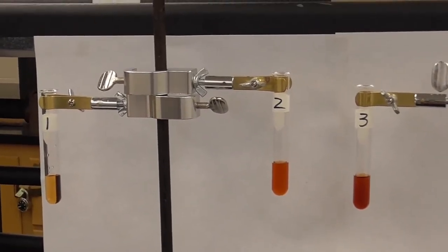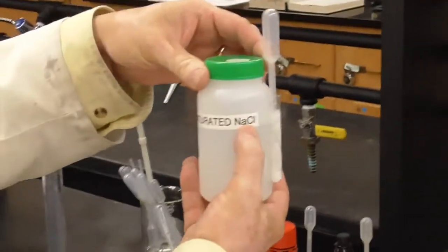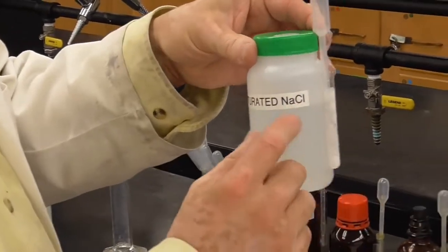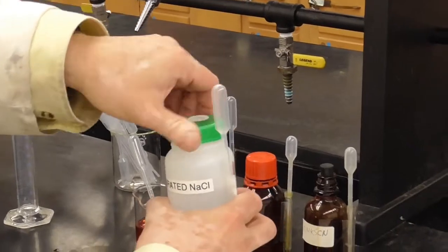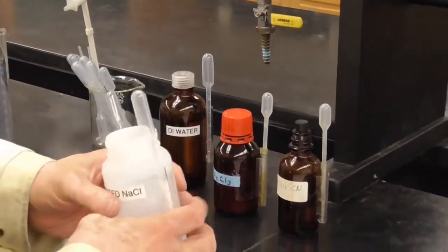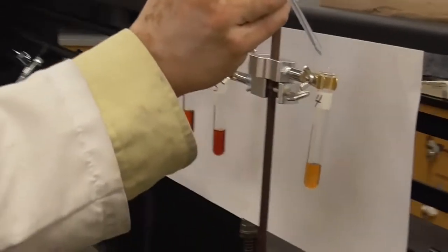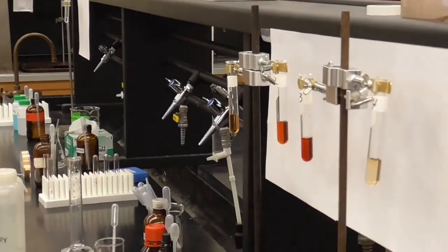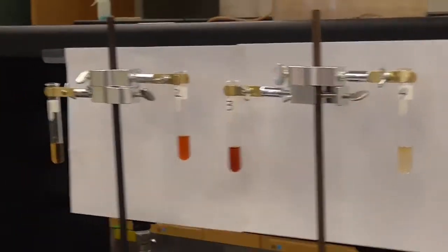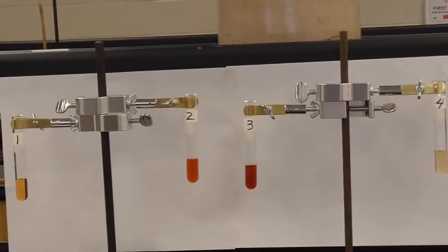We've just done the iron, we've done the thiocyanate, and so for test tube number 4, here's saturated sodium chloride. So this is very high concentration of the chloride, Cl-. This is the spectator that we were talking about, and we're going to add 10 drops of this, which will be adding a whole bunch more of that spectator. Let's see what happens. 1, 2, 3, 4, 5, 6, 7, 8, 9, 10. Okay. Let's just zoom in on those test tubes and look at the differences of the colors.